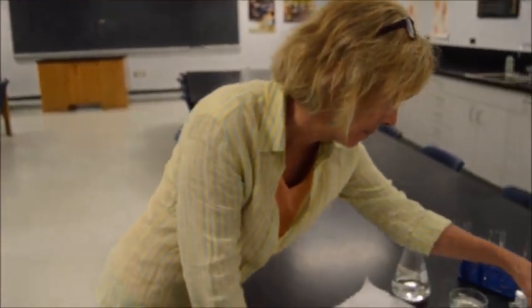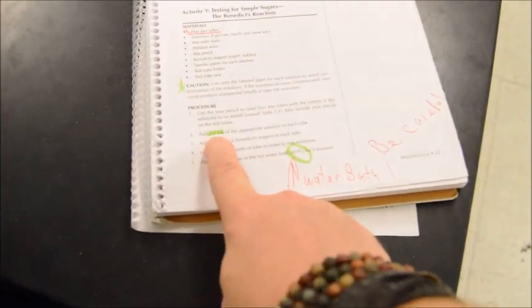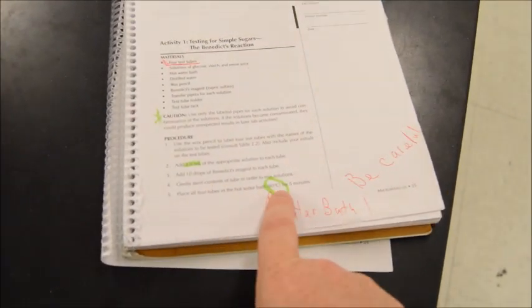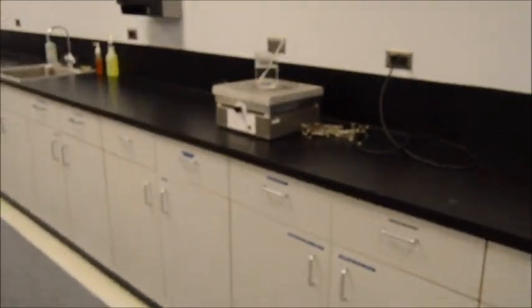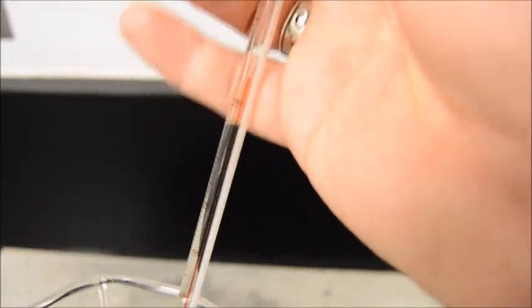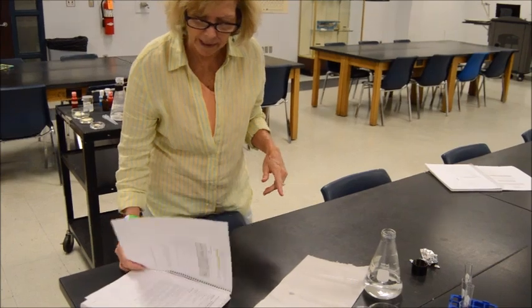All right, so we're going to follow our directions here: 2 milliliters of each of the solutions and 10 drops of Benedict's reagent into each tube. Then we're going to place them in a hot water bath at roughly 80 degrees, which is what we have. It's hard to see here. Let's see if I can get right in on it. That is right around 90 degrees Celsius, which is just fine. Karen, is that close enough? Looks good. Remember, we're on pages 25 and 26 in our lab book to carry out the Benedict's test.